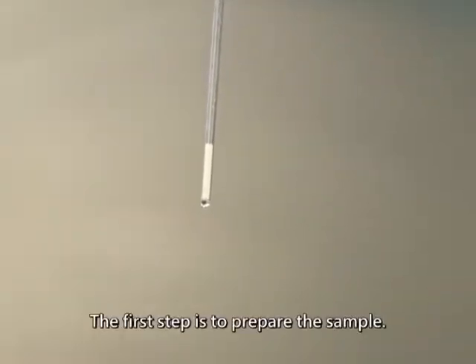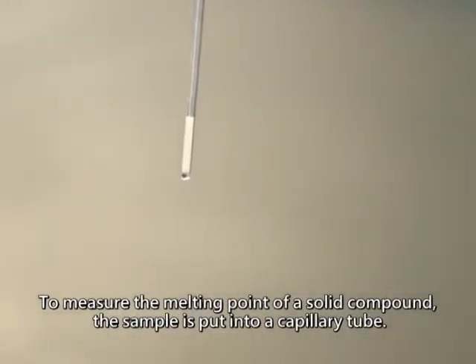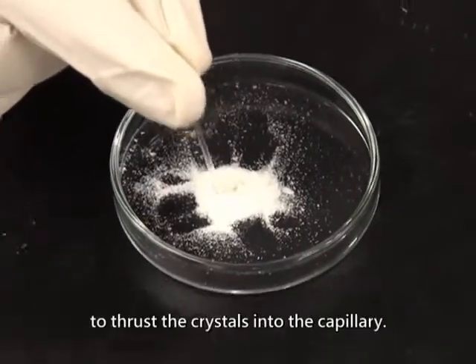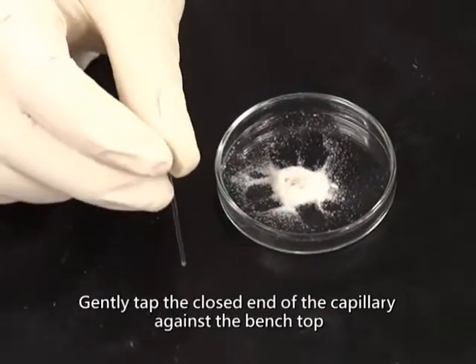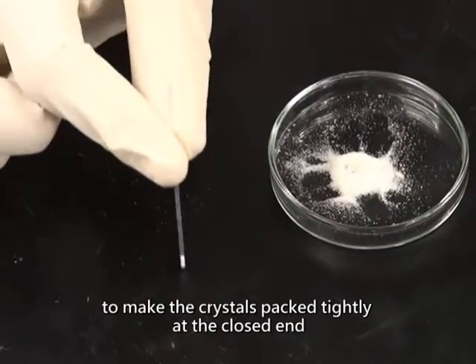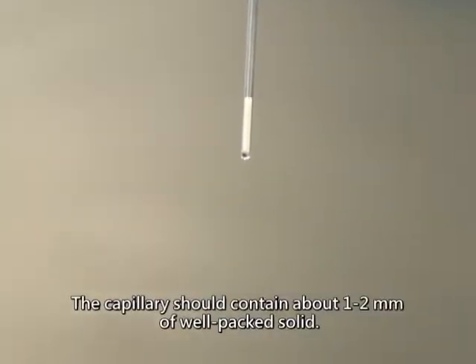The first step is to prepare the sample. To measure the melting point of a solid compound, the sample is put into a capillary tube. Tap the open end of a capillary onto a heap of powdered solid sample to thrust the crystals into the capillary. Gently tap the closed end of the capillary against the benchtop to make the crystals packed tightly at the closed end. The capillary should contain about 1 to 2 millimeters of well-packed solid.